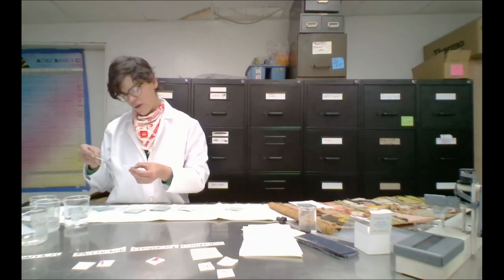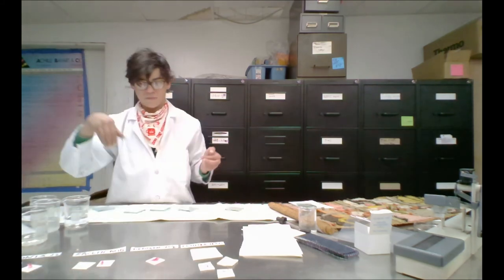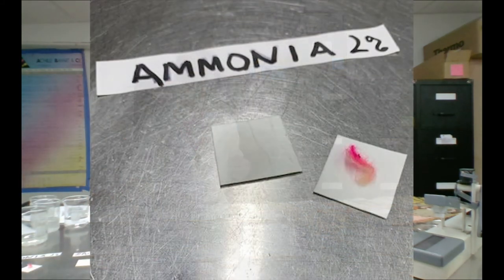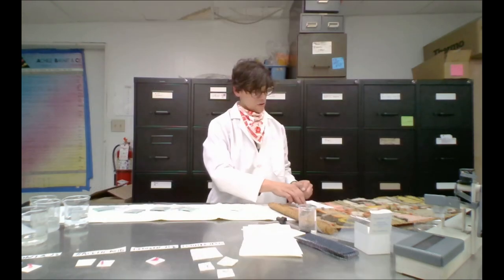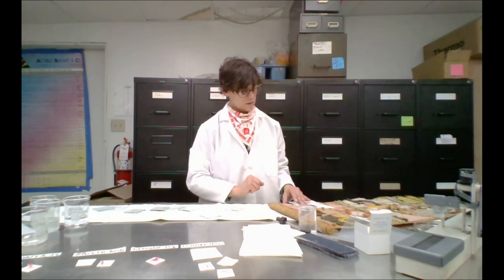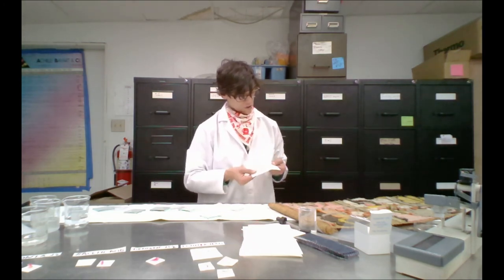And over here, our spot checking test showed some dirt residue coming off.